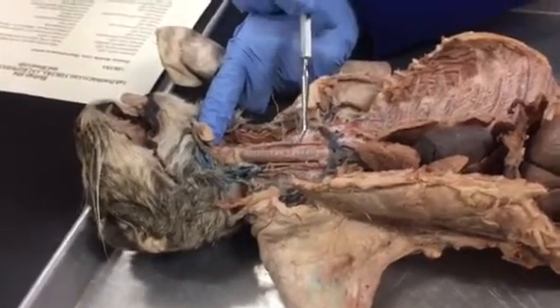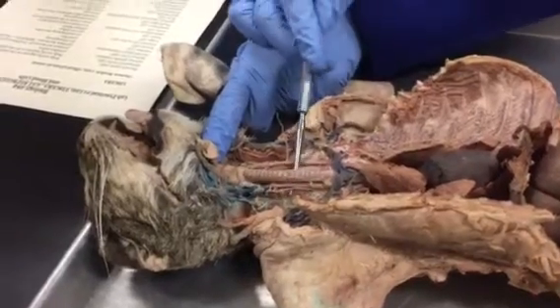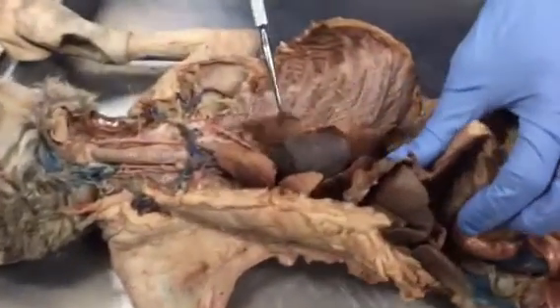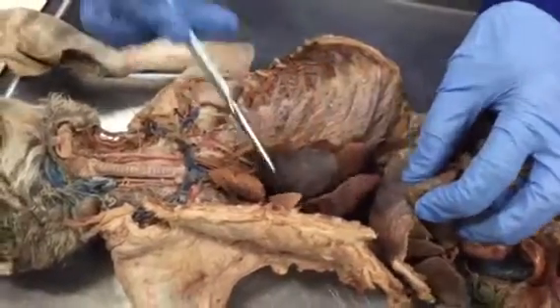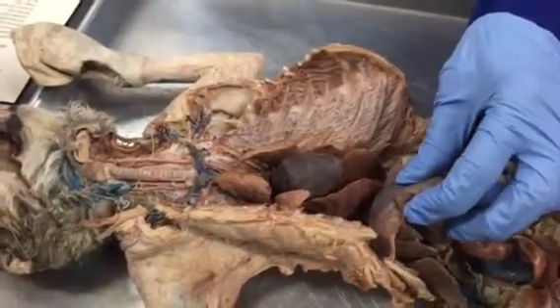And the trachea has these rings which are made up of cartilage, and they help keep the trachea open. Lungs. So these are the lobes of the lungs, these ones. On both sides, we have the lobes of the lung, which are on both sides of the heart. So those are the lungs.